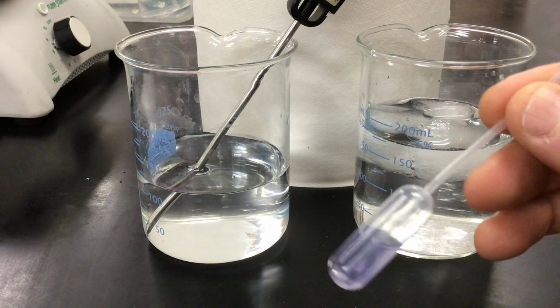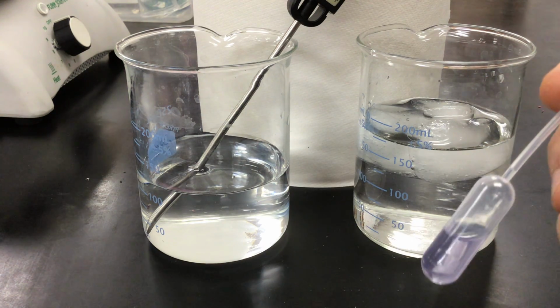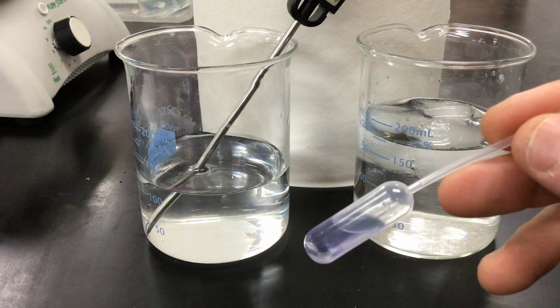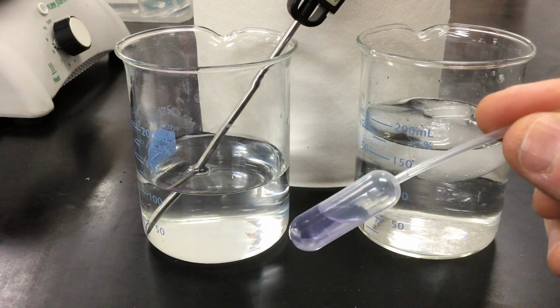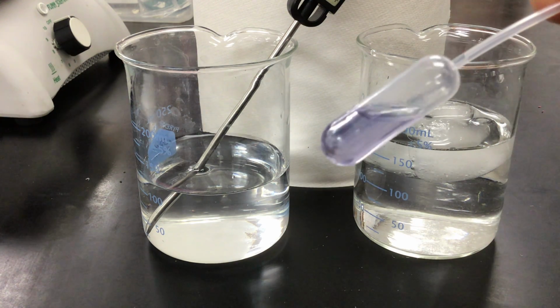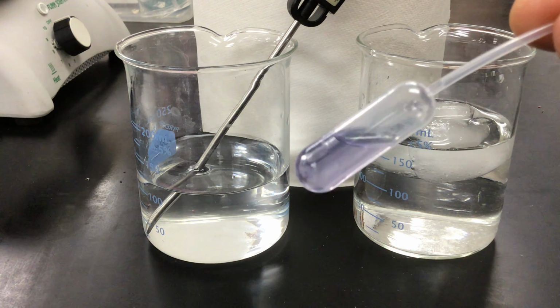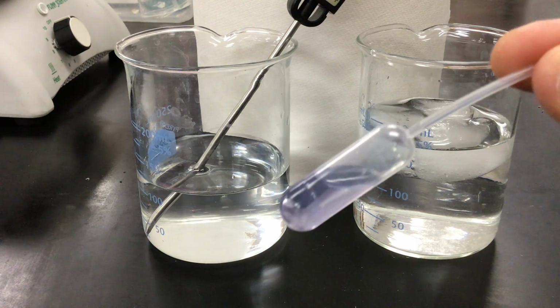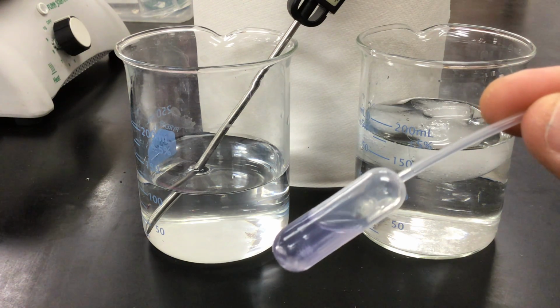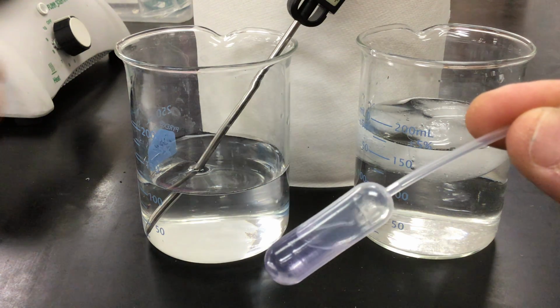Okay, instead of adding something to it, the stress is now going to be a temperature stress. Unlike the other ones, which were concentration changes to the vessels, we are now going to look at how temperature can affect an equilibrium reaction. So this system is in equilibrium, and the reaction is going just as much forward as backward, and the result is this purple color. We're going to stress the system, and from adding additional heat or removing heat, it's going to draw the system either left or right of the chemical equation.